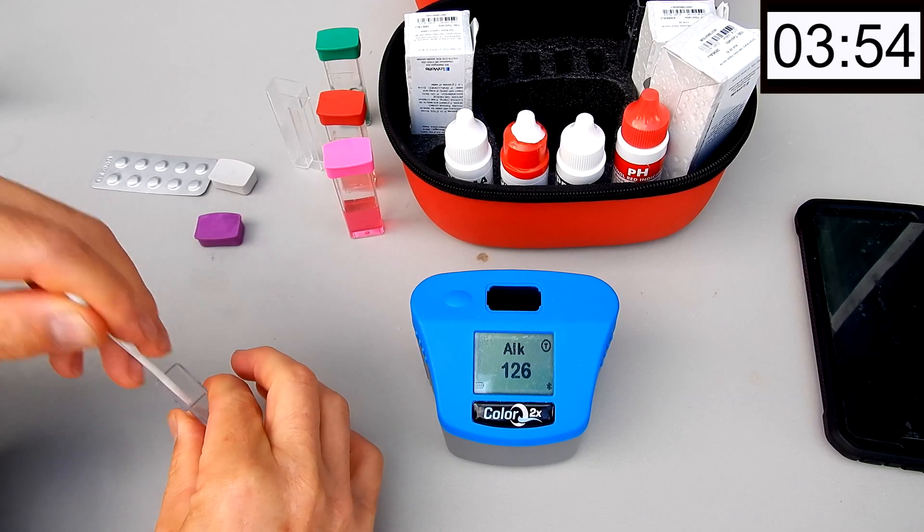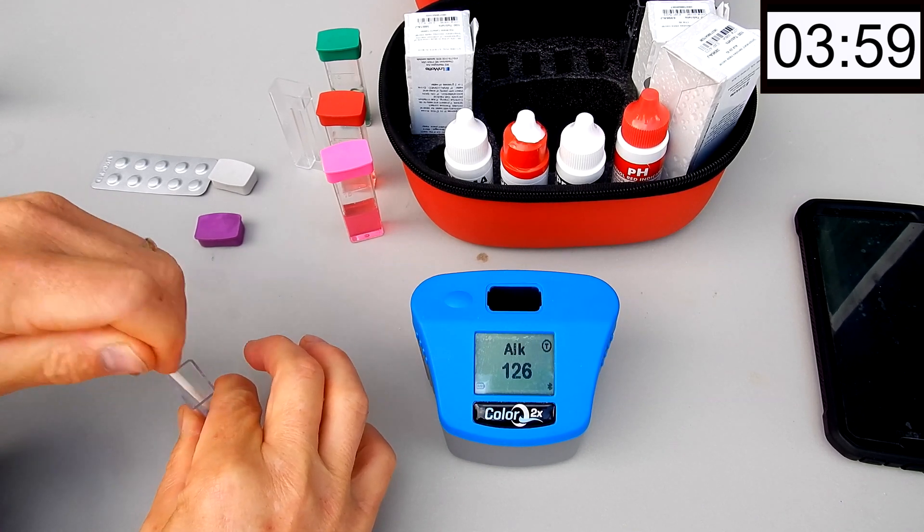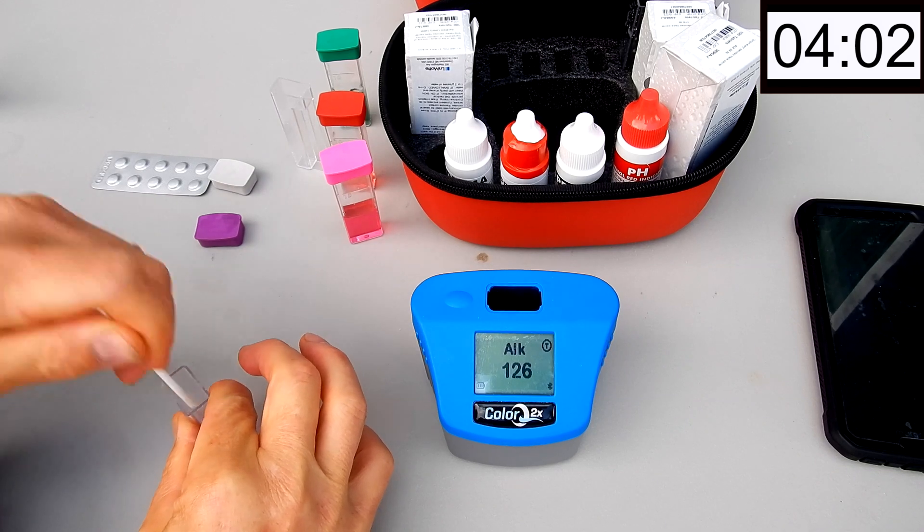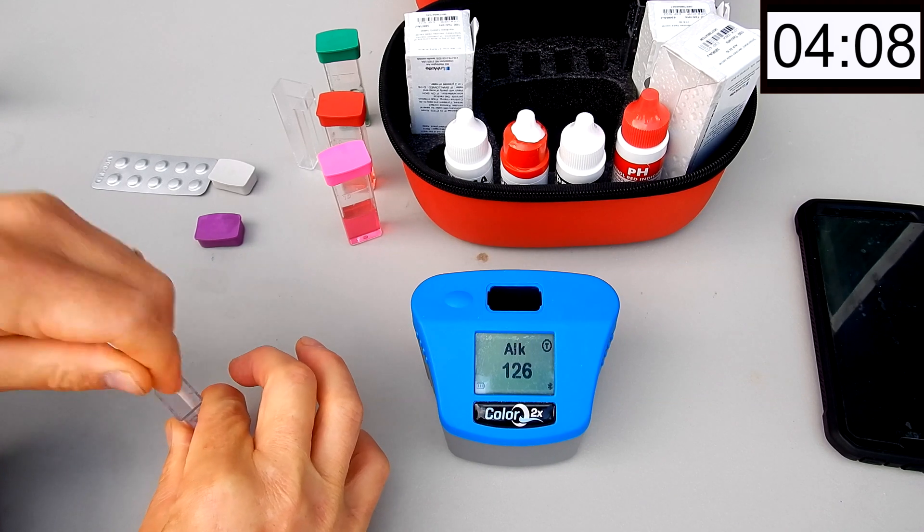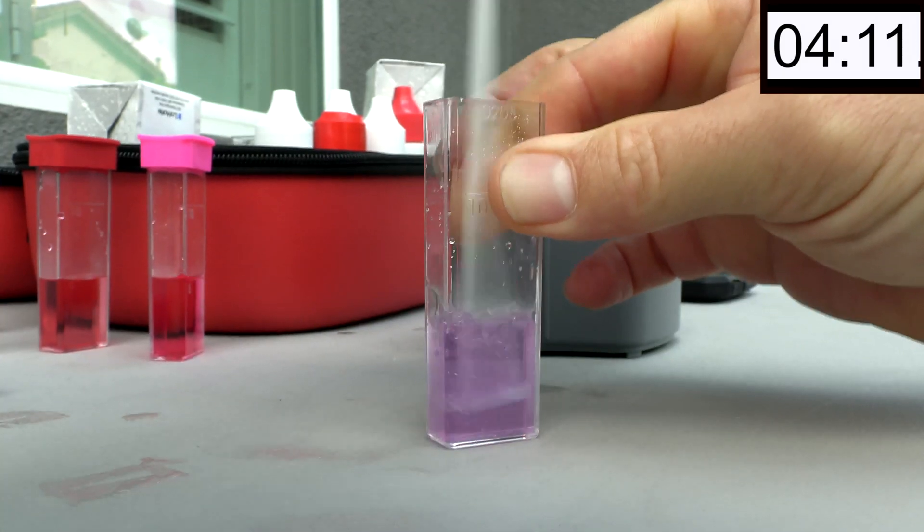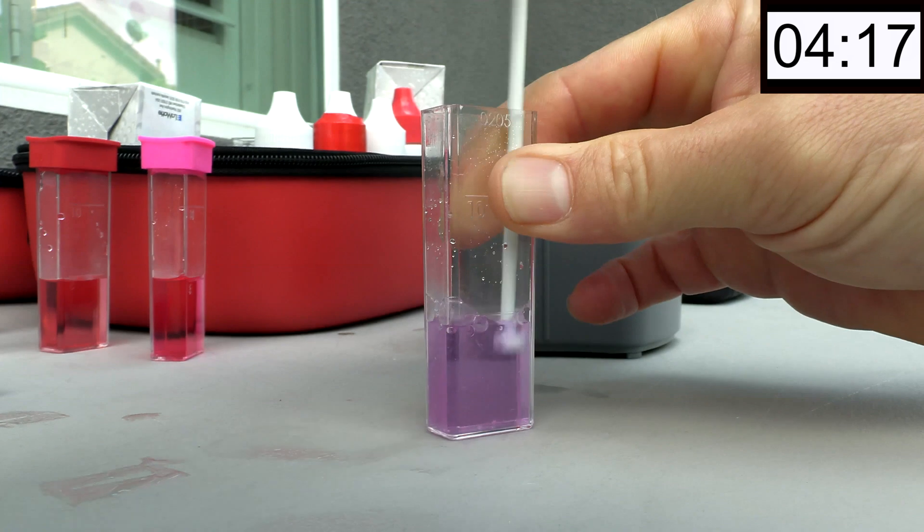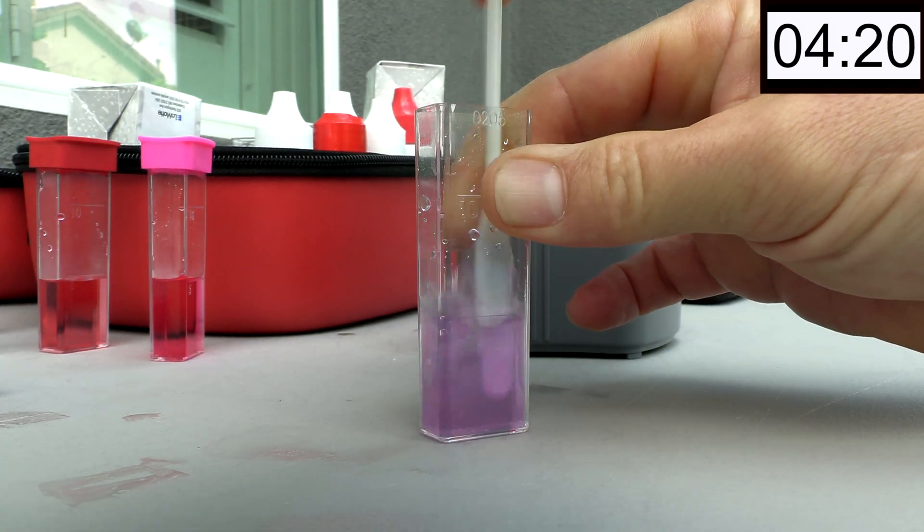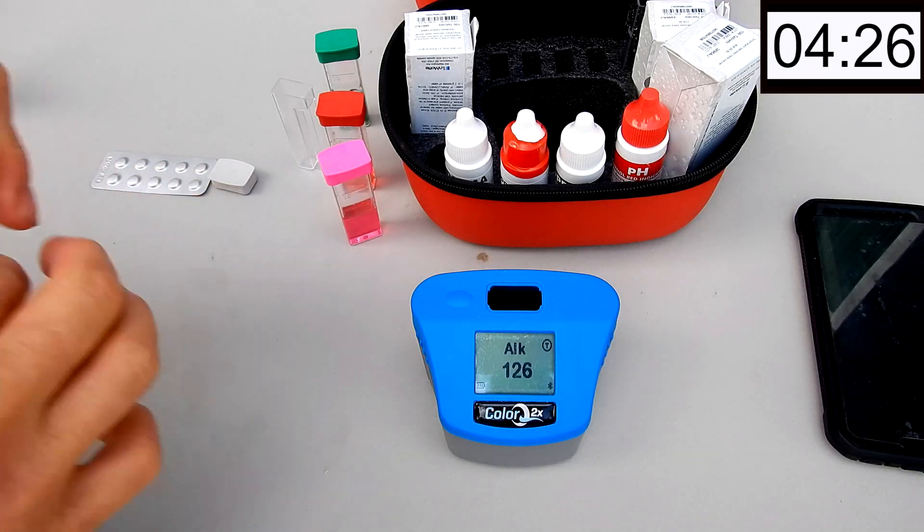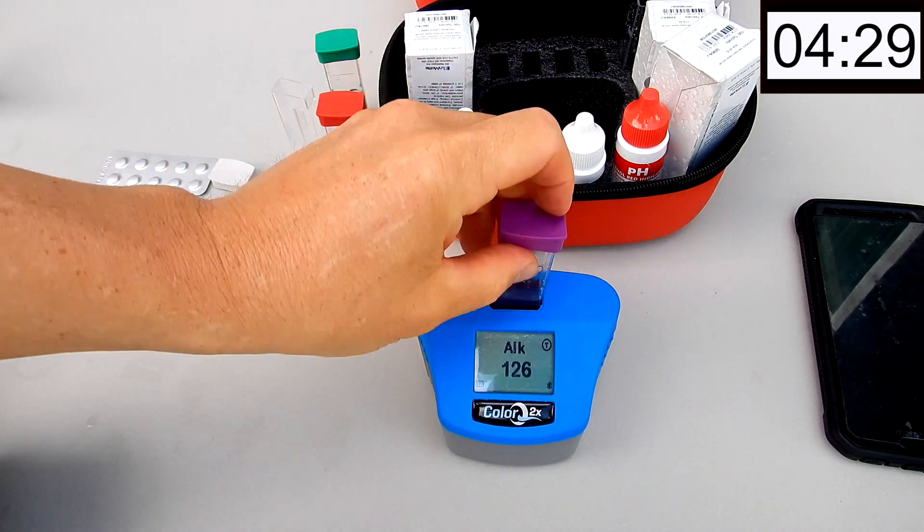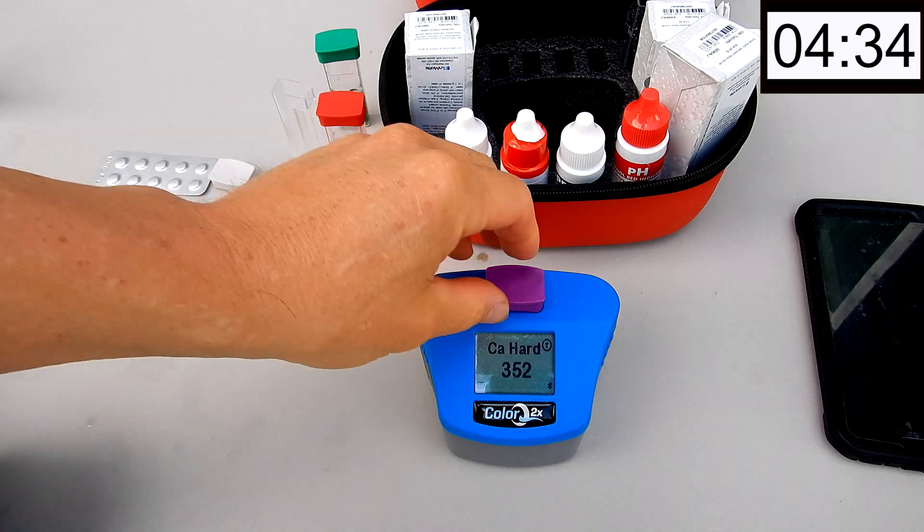And the Calcium Hardness is also a tablet. And these expire on 4/2022. So they have a long lifespan also. The Calcium Hardness reagents would expire very quickly. So I think it was a good idea for LaMotte to change it to a tablet form.